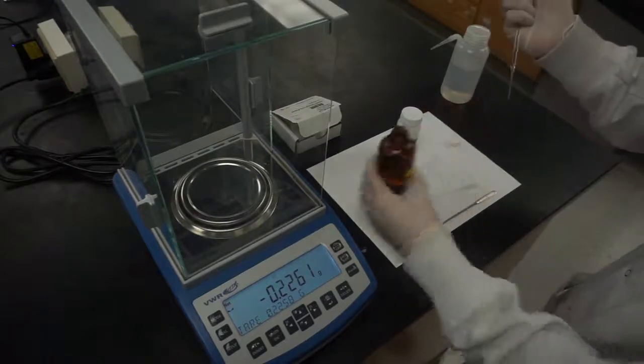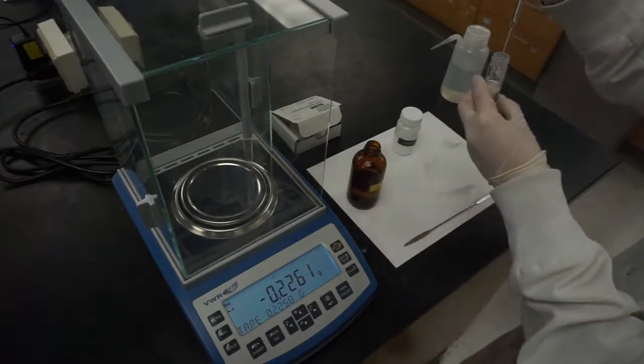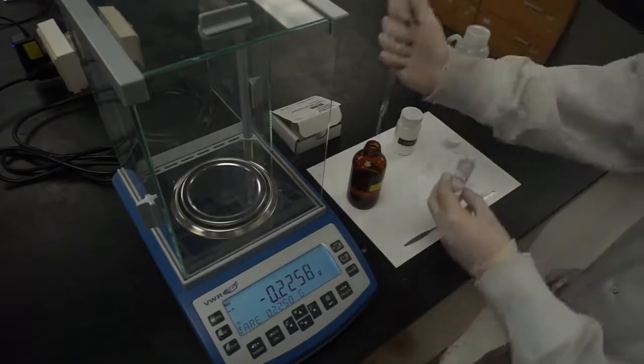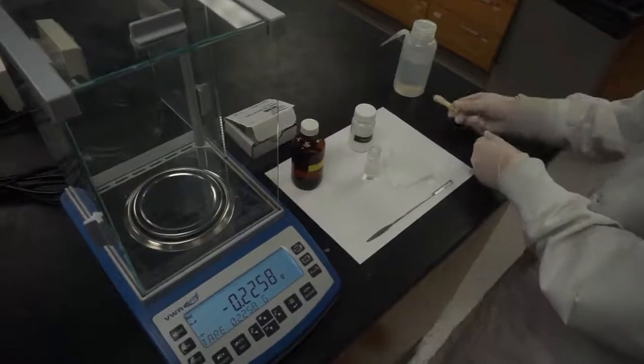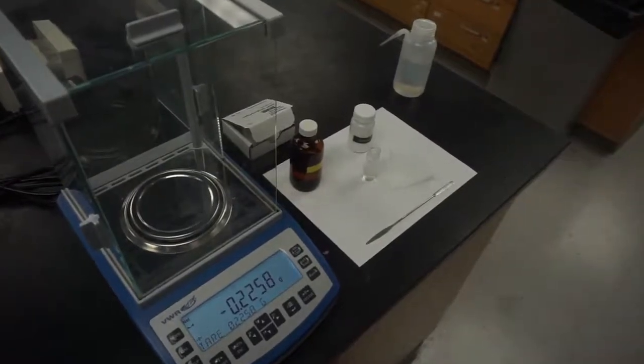A graduated cylinder was not used in this experiment because the actual amount doesn't really matter since we're not doing any quantitative analysis.